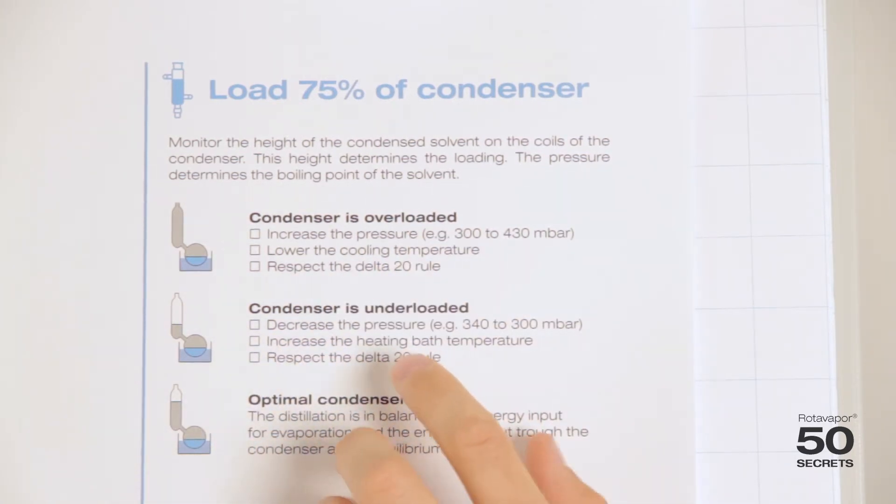You can increase the heating bath temperature, but again you have to respect this Delta 20 rule. If it's loaded like this, then you've done everything correctly.